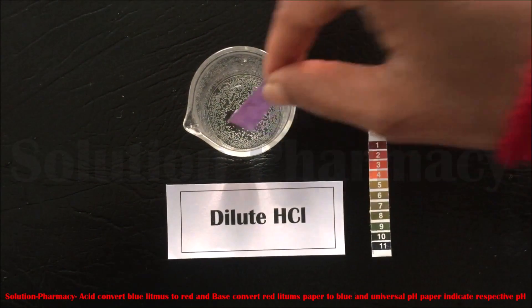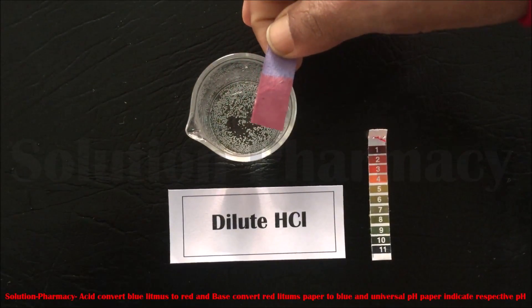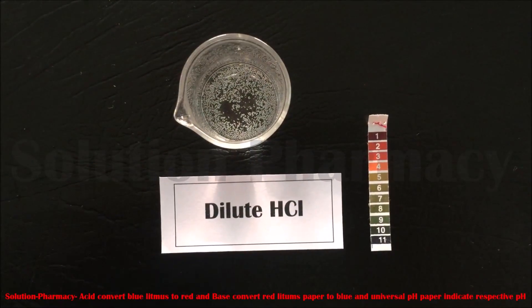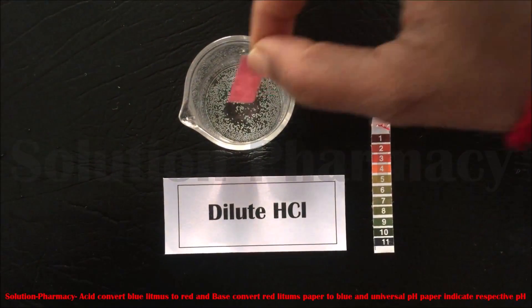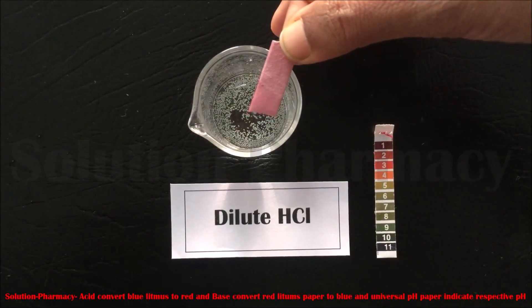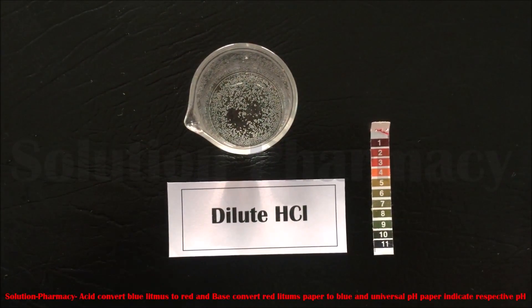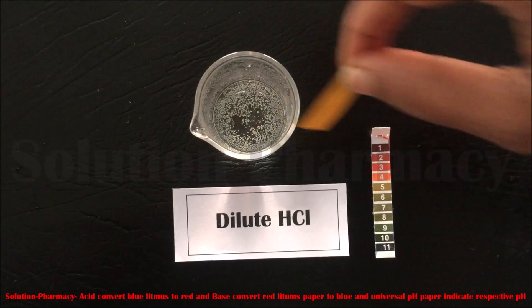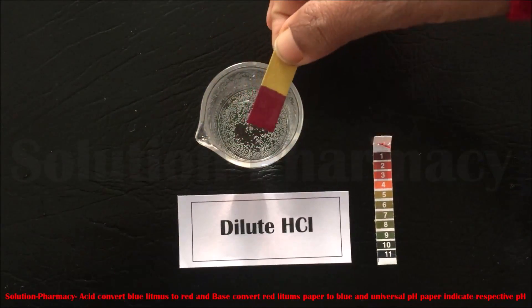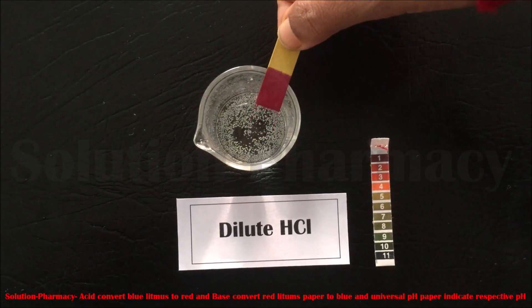The next sample is dilute HCl. Dip the blue litmus — it changes to red, which means dilute HCl is acidic in nature. Next, dip the red litmus paper into it; there is no color change on the red litmus paper. Then dip the universal pH paper to determine the pH of dilute HCl. Remove the pH paper after a few seconds and match the color change with the color chart.